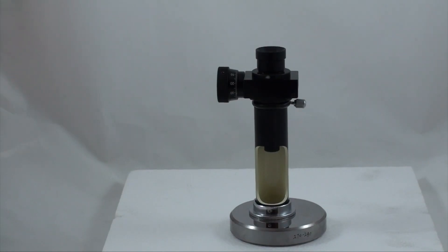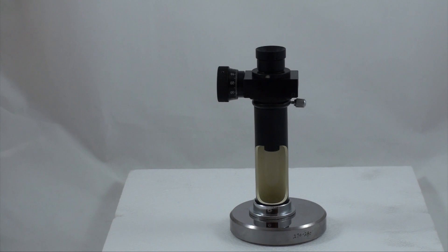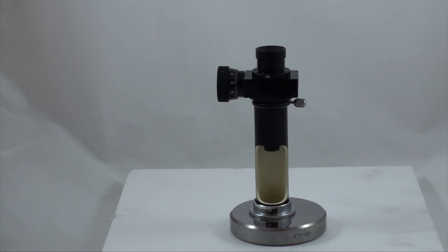Place the microscope on the test block or specimen. Both the numerals and graduation lines on the scale shall be clearly identifiable in the sight range. If the indent cannot be clearly defined, turn the eye lens knob to adjust the sight until it becomes clear. The microscope is calibrated at the factory to make certain that indents can be clearly defined.